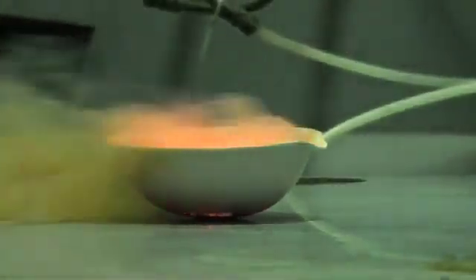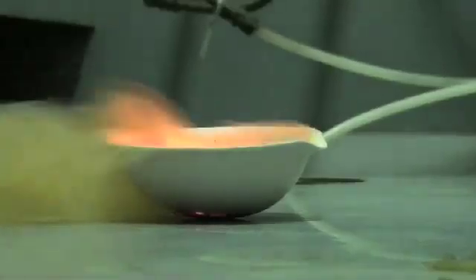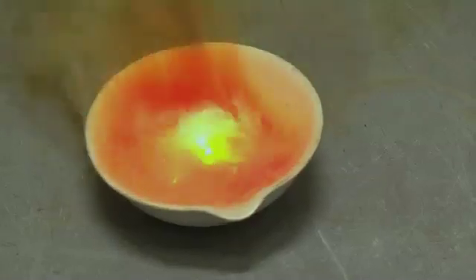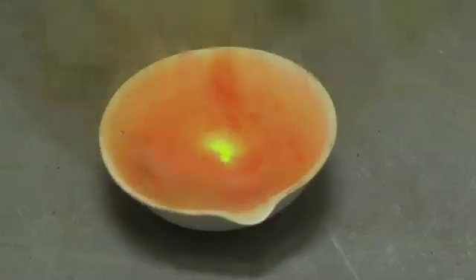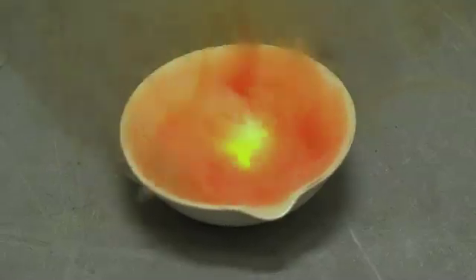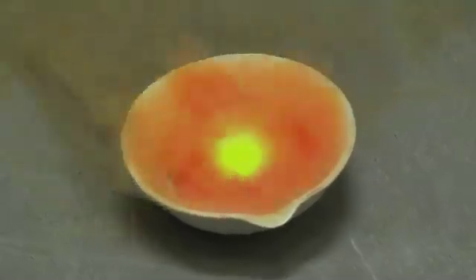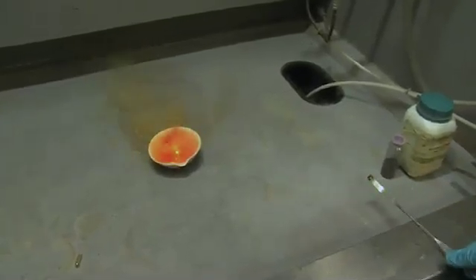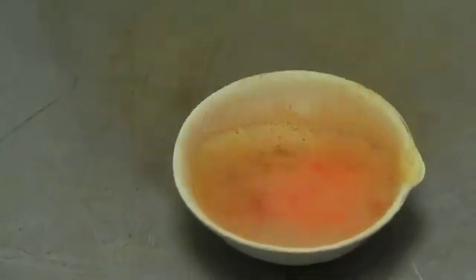Bromine is quite dangerous, but it is less dangerous than chlorine, because it's a liquid at room temperature. Chlorine is a gas, so if you let out chlorine it disperses everywhere. With bromine, it is a heavy gas which can disperse rather more slowly. As the reaction cools down, we can see that the volume of bromine is significantly reduced. It reacts with water quite well.